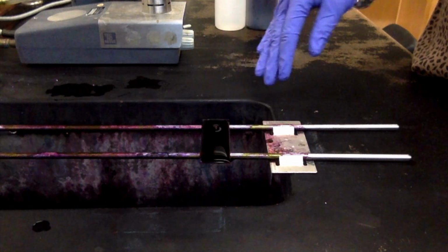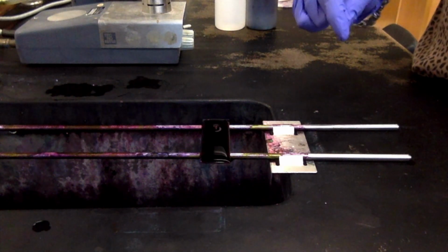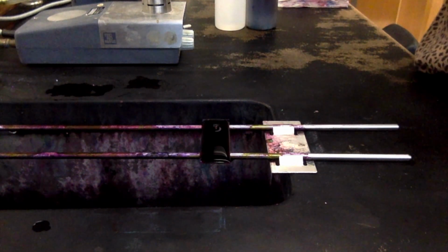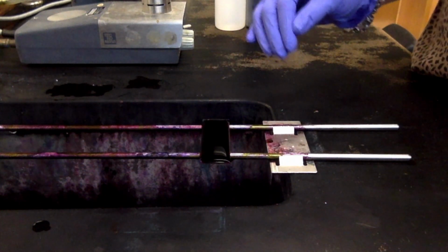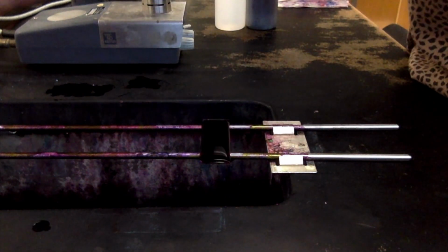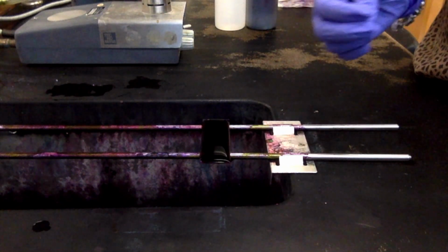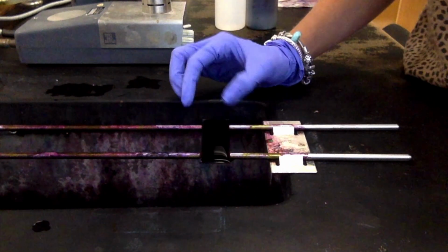We want that to happen for the decolorizing step. So we're going to leave this on for about a minute, and remember what's happening here. The iodine's going into the cell wall, forming that CVI complex, and helping keep that stain in the cell wall of the gram-positive cells. And like I said, we don't want to rinse too much. The first thing I'm going to do is kind of just tap this excess iodine off, and then we'll rinse it a little bit to try to get some of that iodine off. I only really rinse just to get enough of the iodine off to where I can see the smears, because you want to be able to see those smears so you can watch the runoff whenever you're doing the decolorizing step.